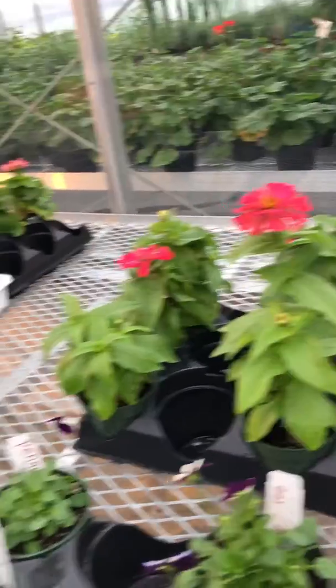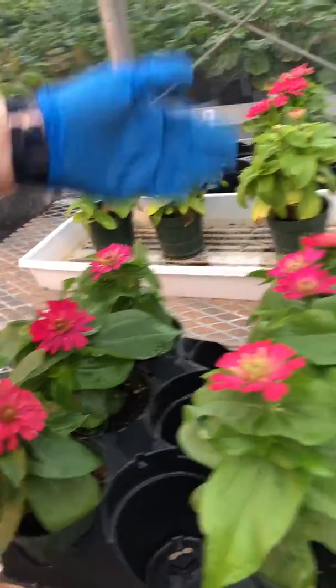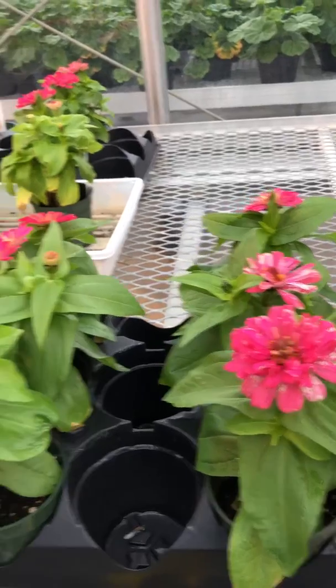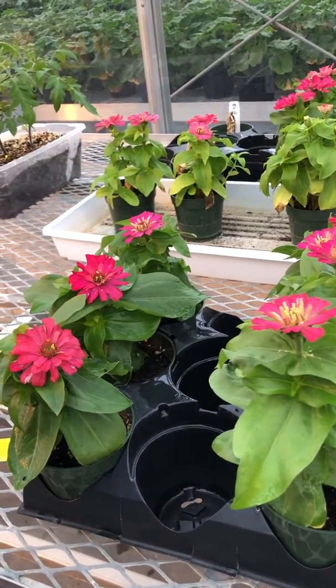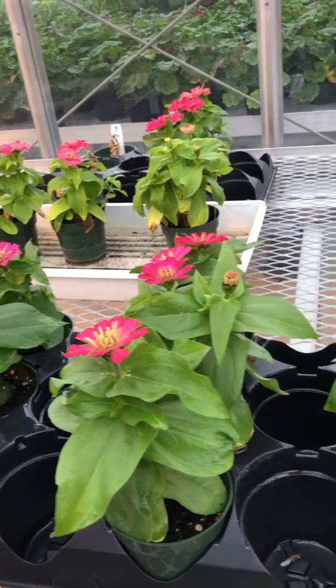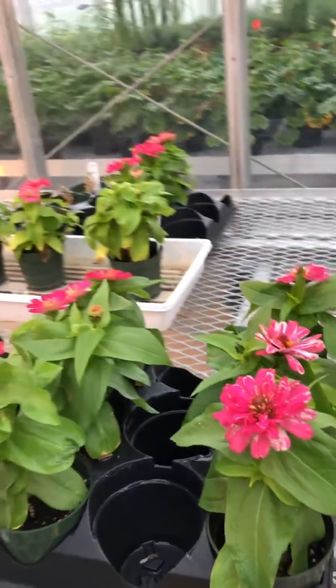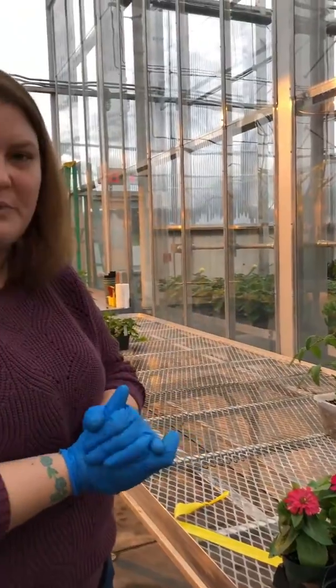This last tray of zinnias, again, is control, 500 and 1,000, and you don't really see too much difference between these. There could be human error with watering. Maybe some of them didn't get watered enough, so they got stunted that way. Maybe they didn't take in the gibberellic acid quite like some other plants did when you sprayed it on the leaves.